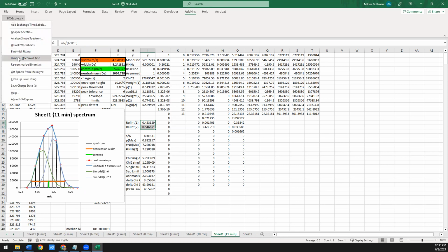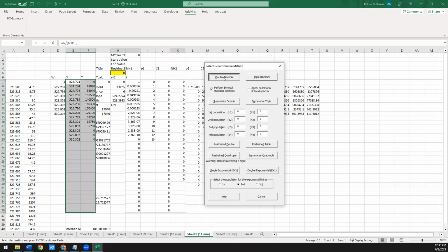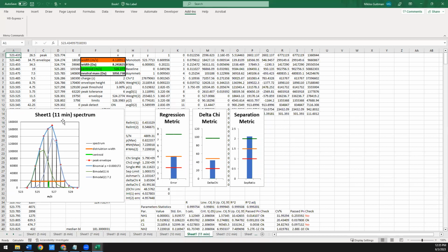So if you go back to binomial or bimodal distribution deconvolution, now instead of just hitting double binomial, if you check this perform bimodal statistical analyses box and then do a double binomial, it'll do the same thing again. However, it does an extra routine where it looks at all the regression metrics through all of the fitting that it did. And it uses that information to extract a standard error for each of the parameters that it's able to extract for these fits. And by looking at those standard errors, we can actually get a pretty good idea of how well we can trust the numbers.